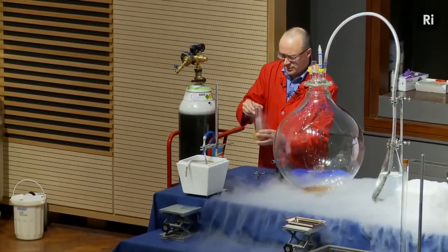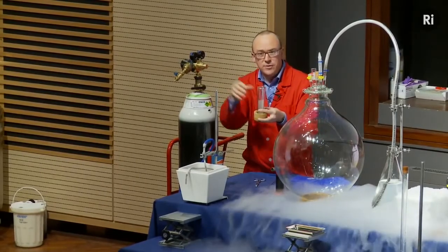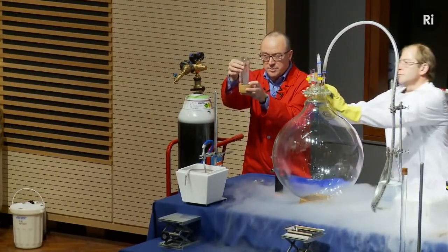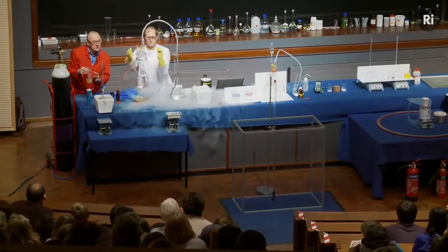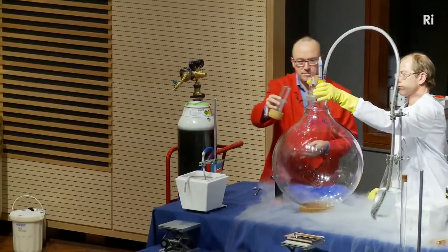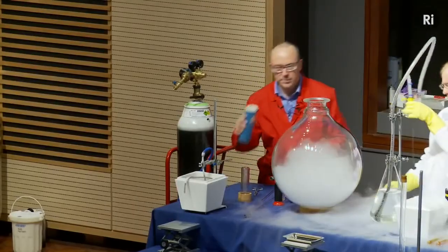And you may be able to see that although the air contains 1/5 oxygen, and the air, of course, is completely transparent, yet oxygen, when it becomes a liquid, turns this lovely blue colour. Okay, so we're going to use this liquid oxygen then to fill this flask with oxygen. So I'm going to pour this in, and we'll add a bit more for good measure.